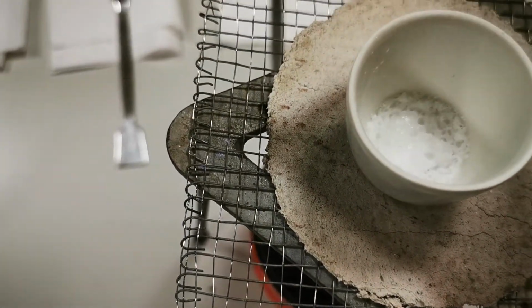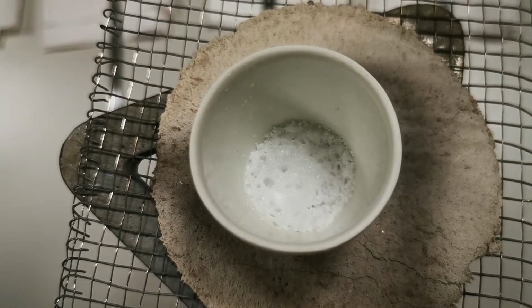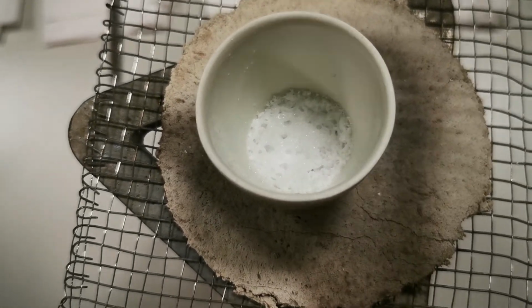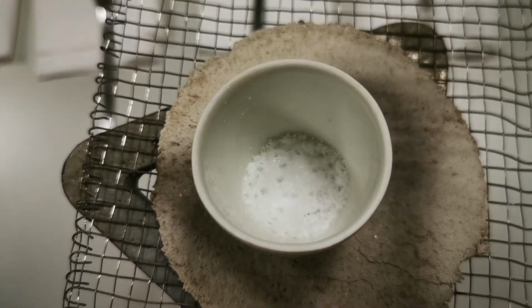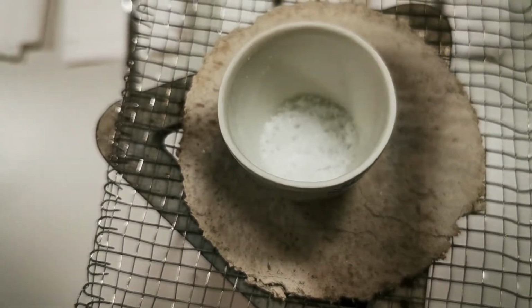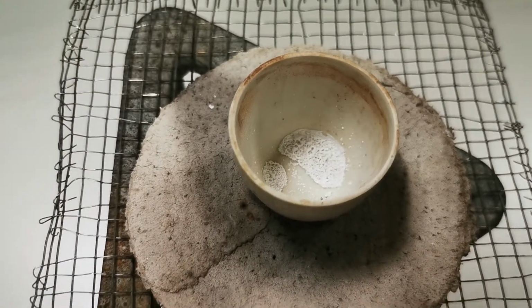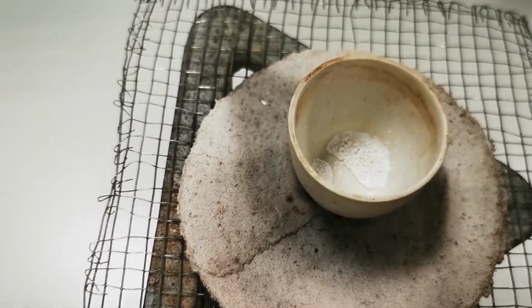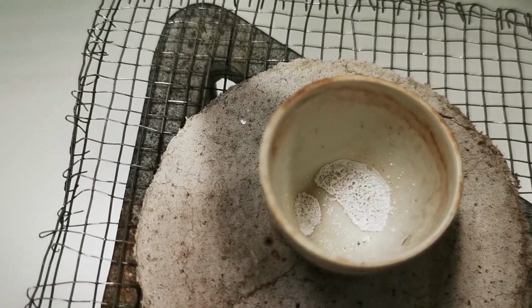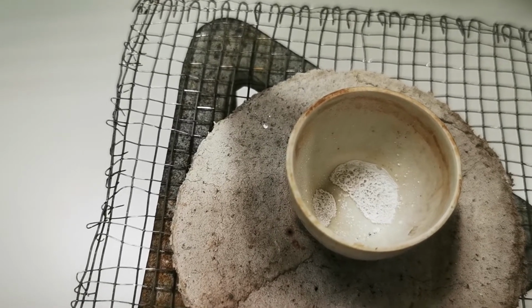This is the calcium nitrate X hydrate. So you can see here that many molecules of water started to evaporate. Now the color, the texture of the hydrate definitely is different from the texture of the anhydrous. Okay, so the hydrate is more like crystals, the anhydrous is more like a powder. So the barium hydroxide hydrate is almost done, so I'm going to turn it off. You can see clearly that the hydrate turned completely into anhydrous. So I'm going to turn off this one.